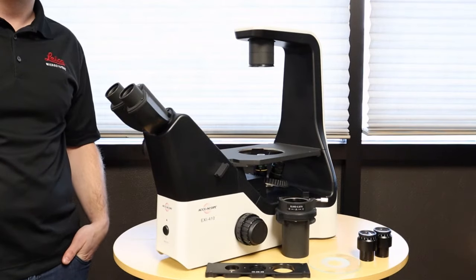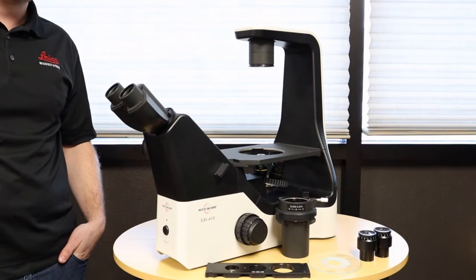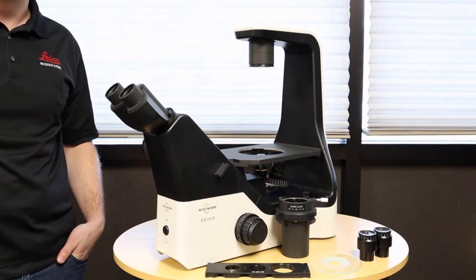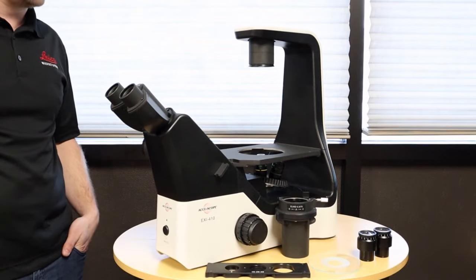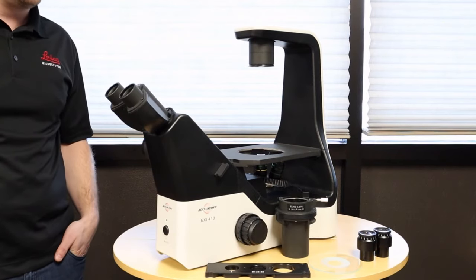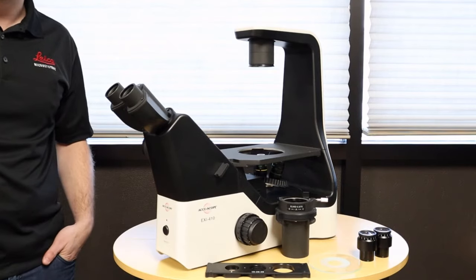This video is an instructional video on how to assemble the Accuscope EXI-410 inverted phase contrast microscope. The EXI-410, as you can see, ships pretty much assembled with just a few components to put on.